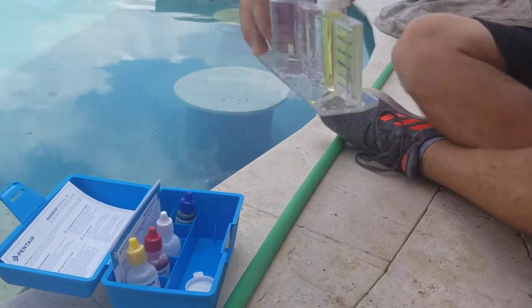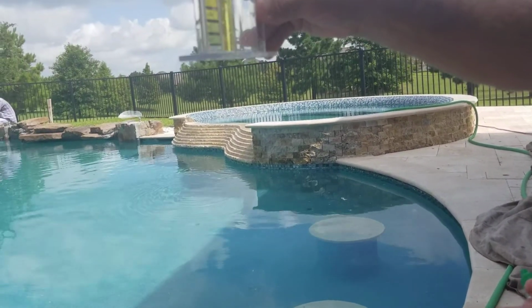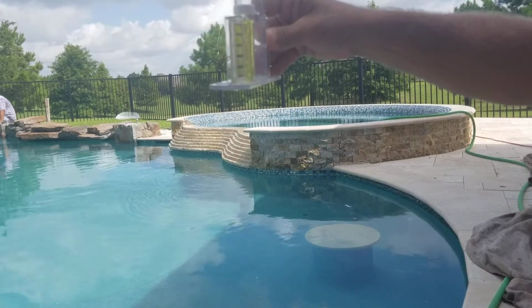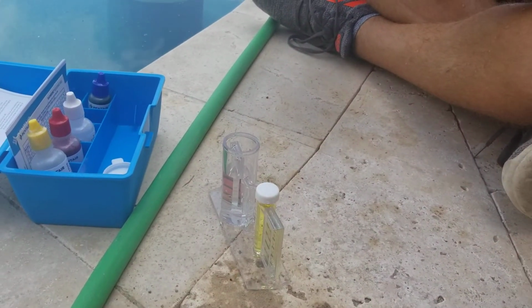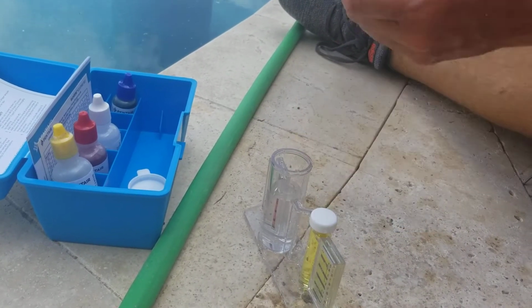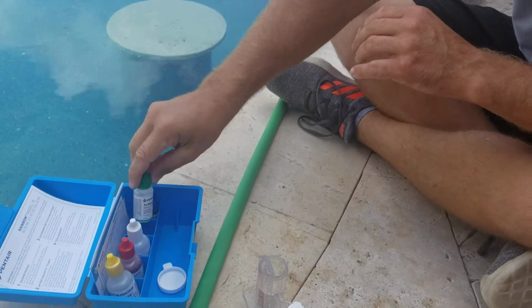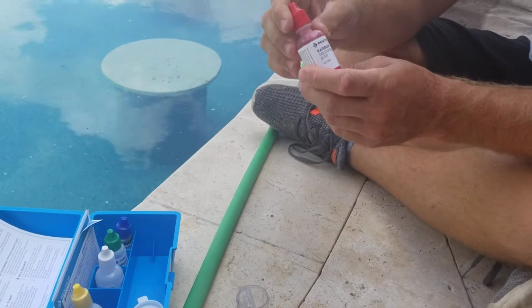Well, I keep looking at it. Man, it's actually high. It's high, yeah. Wow. That's impressive. So I haven't put chlorine in yet. Yeah. We'll add 2 drops to neutralize it. 1, 2. That's the green solution. The green one, yep. And next, you'll add 5 drops of solution 2.